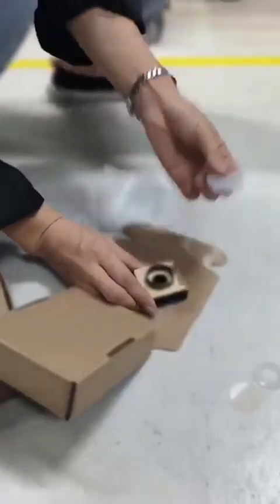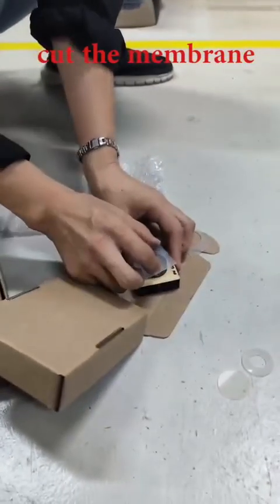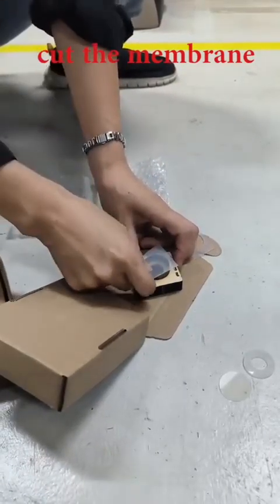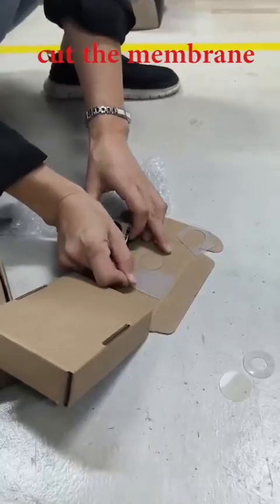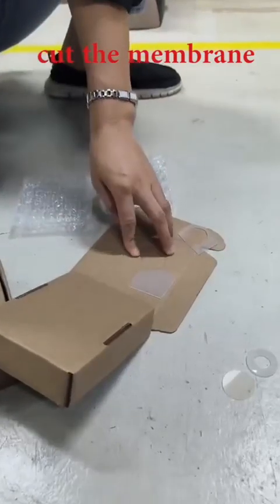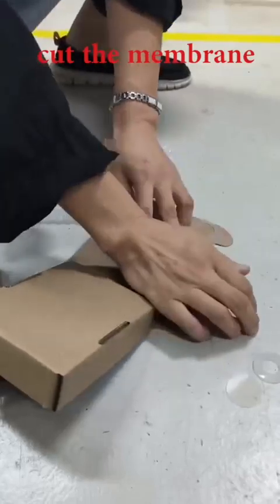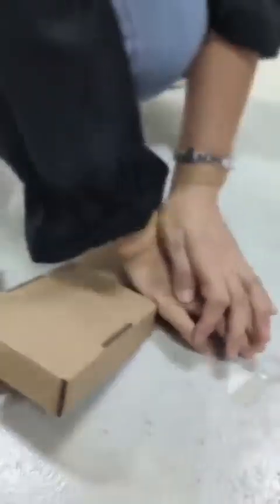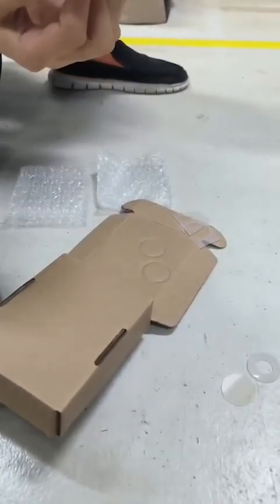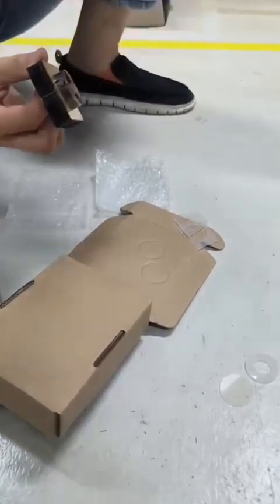For cutting the membrane, you have two ways. One is to put the membrane on top, hold it, and knock it. But I don't like that way. Sometimes it slides. So I like to put a paper board on the table. Then I use my cutter, focus on the position, and use my weight to push it. Then you will get your slice.